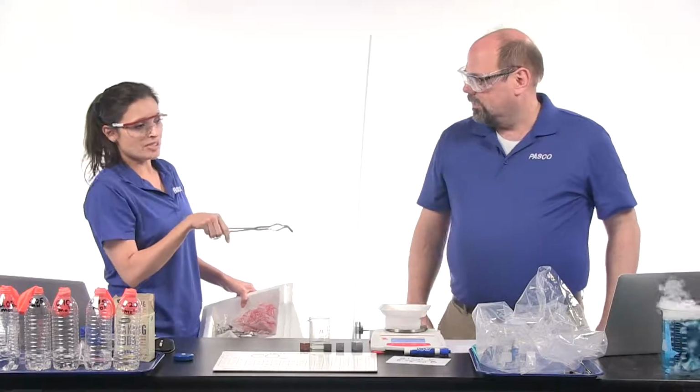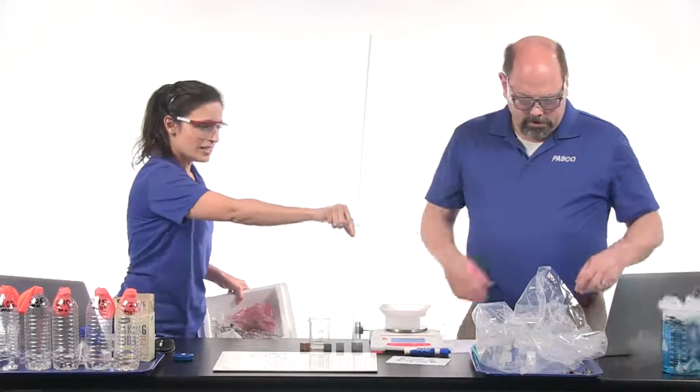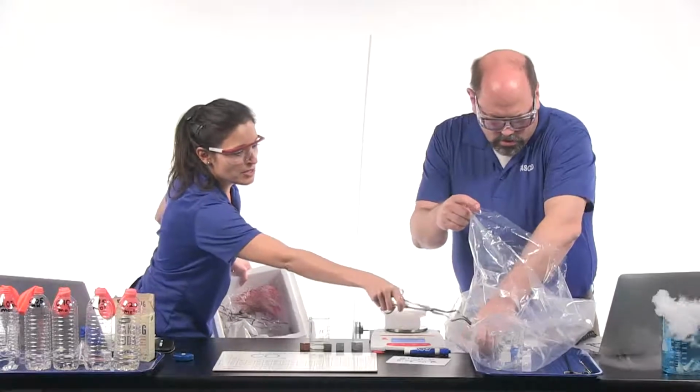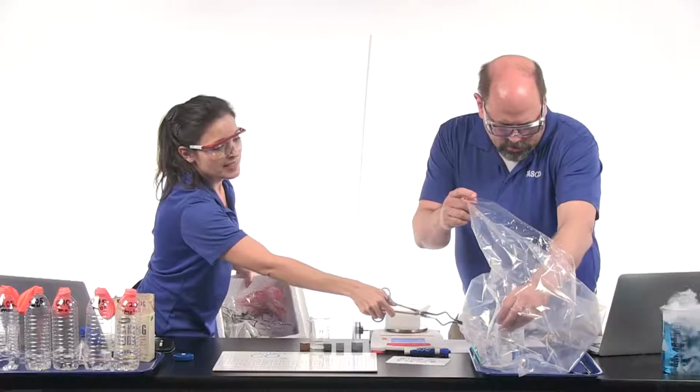So we need a closed system if we wanted to capture just the carbon dioxide gas, so let's do that. We've got some sensors connected to JP's computer. Let's make sure that pressure sensor ends up in the beaker, just in case water splashes out. Okay, they're both turned on.